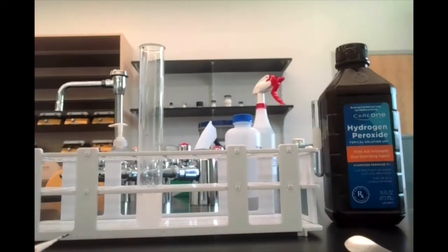So a quick note about how you would write this reaction out. Obviously, hydrogen peroxide, H2O2, is our reactant, and our products are water and oxygen gas. Now the question a lot of students ask is, how do I represent yeast in this reaction since it wasn't a reactant? I can't put it to the left or the right of the arrow because it's neither a reactant nor a product.